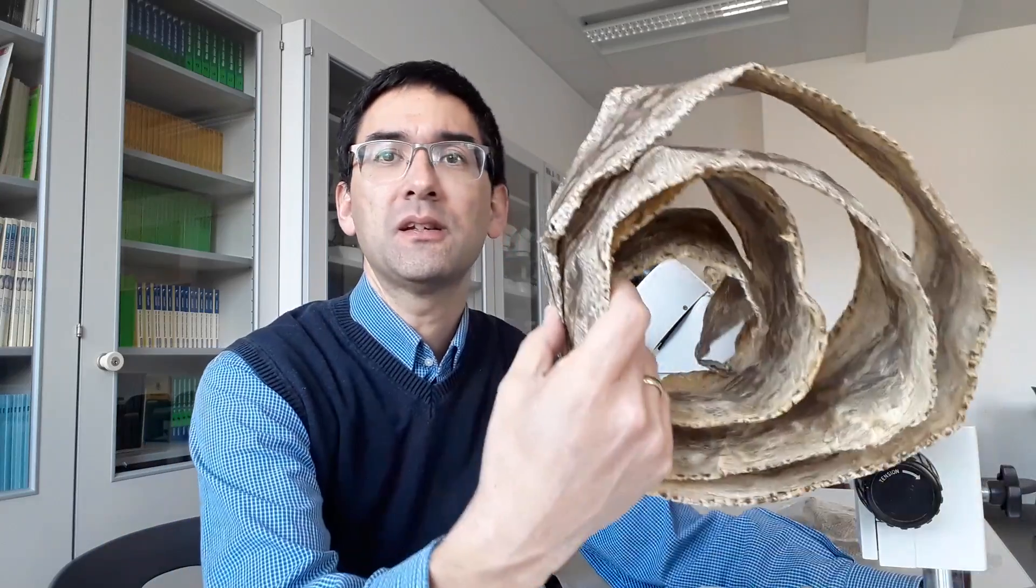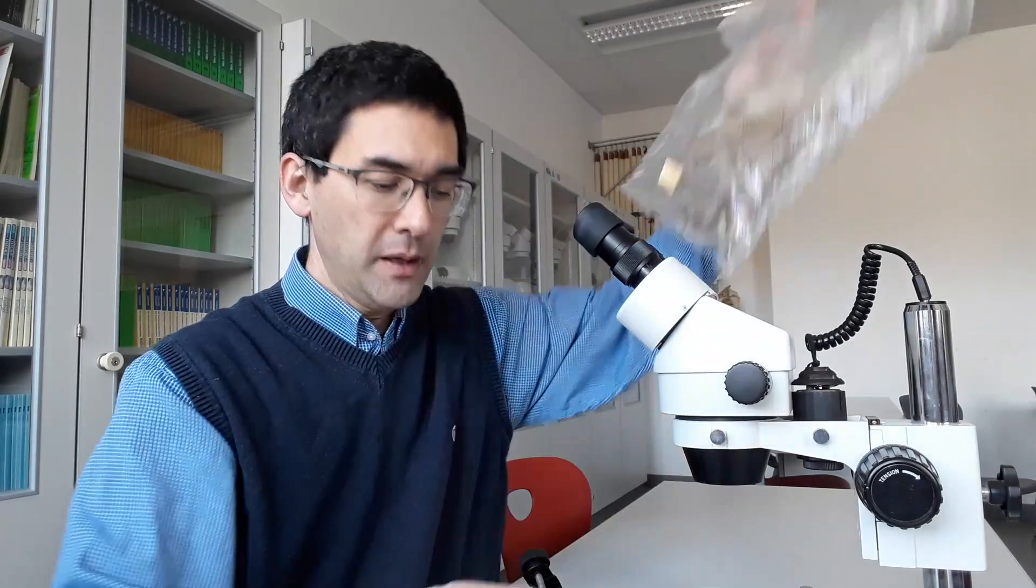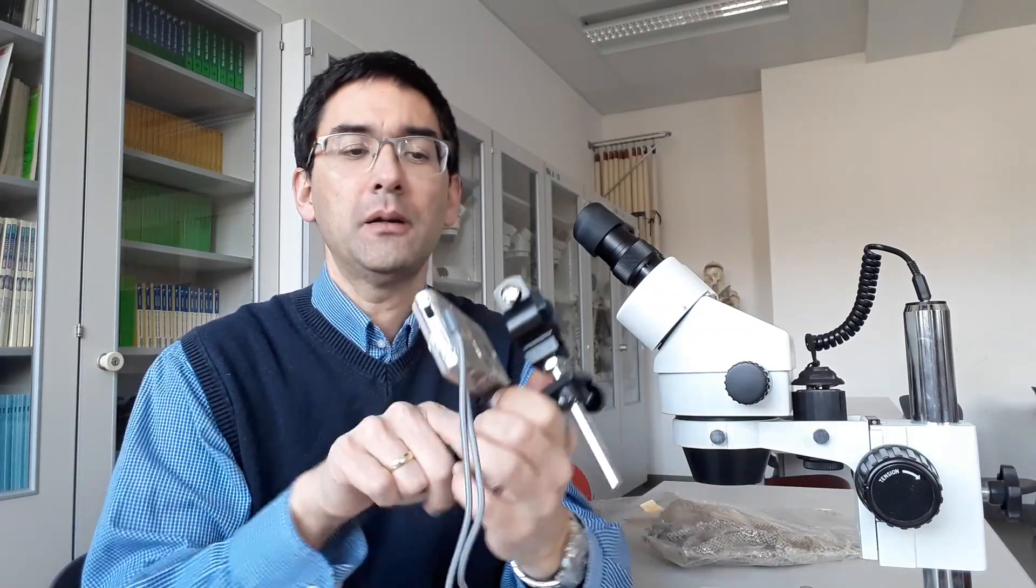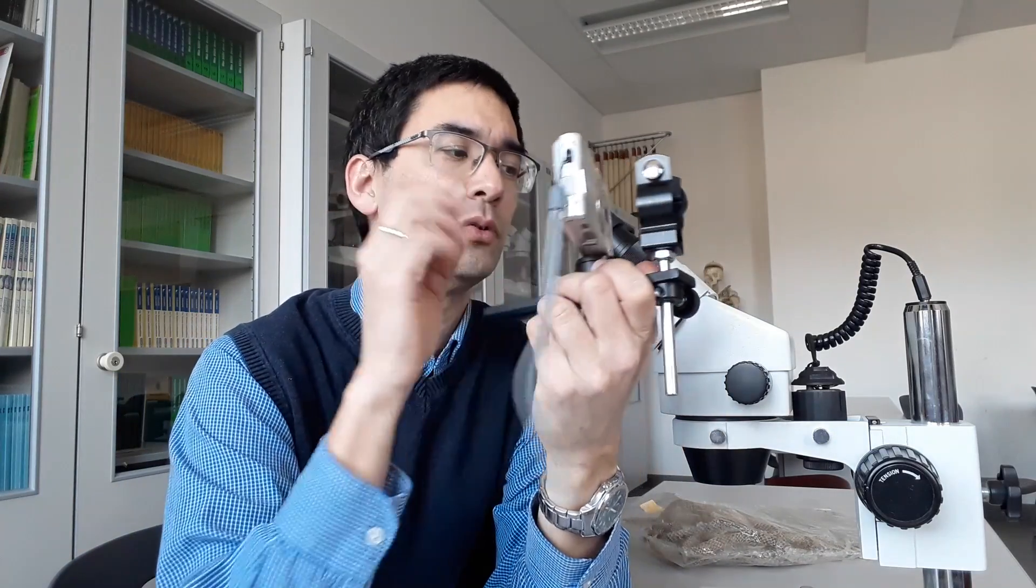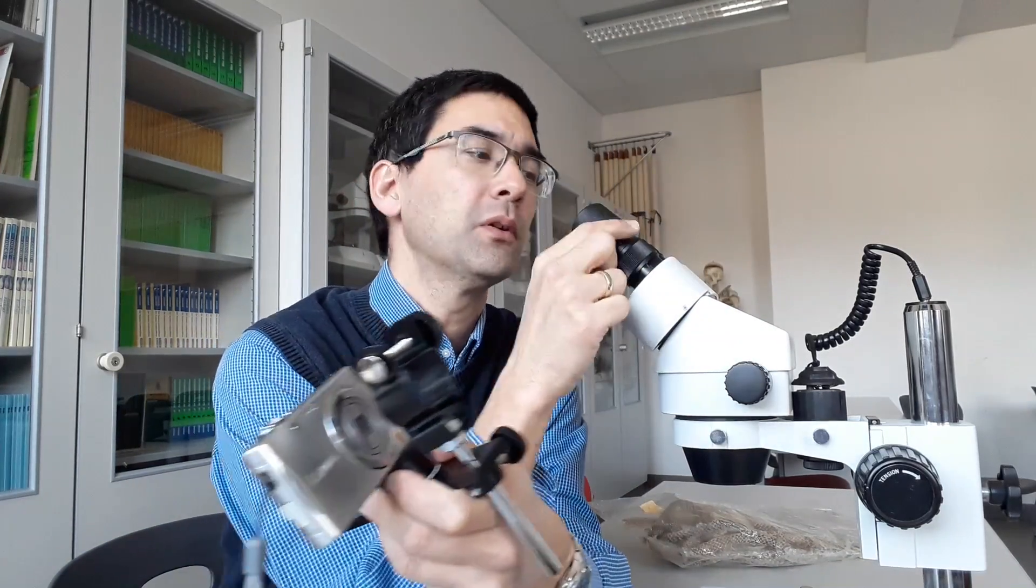Now I will be placing this snake leather, or snake skin, under the microscope along with the one I showed you before. Then I will connect my small pocket camera to the microscope so I can show you some pictures and videos.